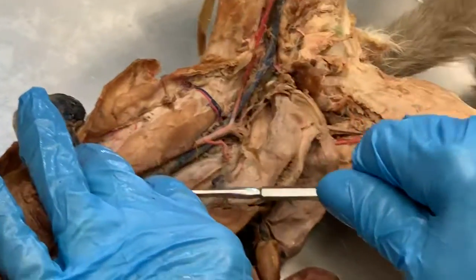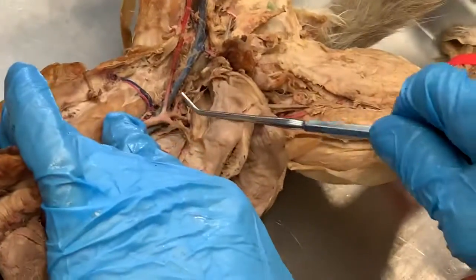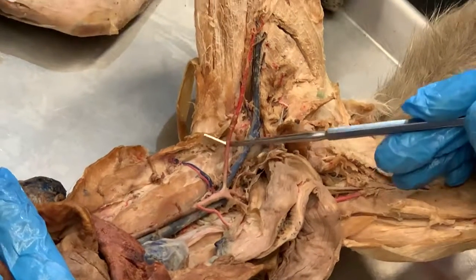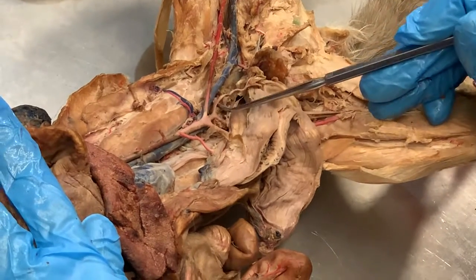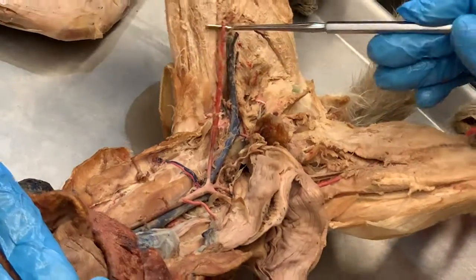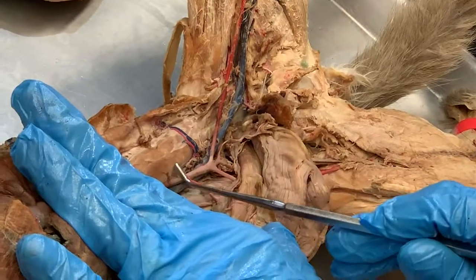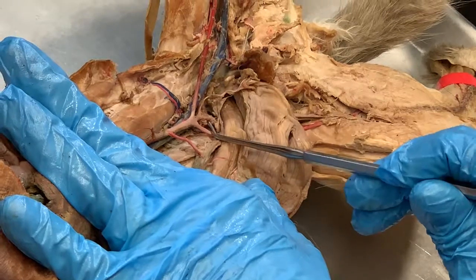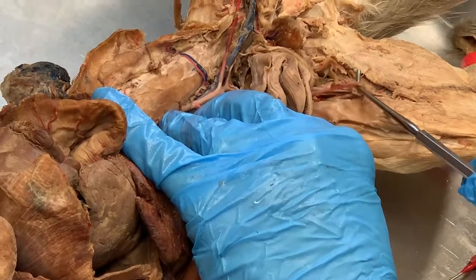Now, the abdominal aorta goes all the way down and then it branches off, goes down into the left leg, goes down into the right leg. Here, this is the left external iliac artery. Way deep here is the left internal iliac artery. External iliac artery then goes down into the leg as the femoral artery. And the same thing happens on the right. Inferior vena cava, right external iliac artery, right internal iliac artery, external iliac artery becomes femoral artery down here.